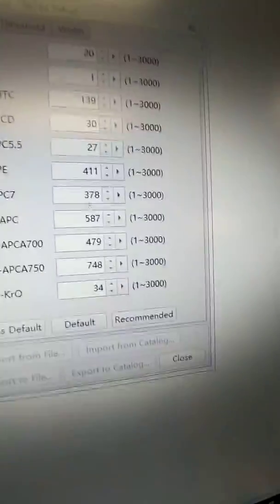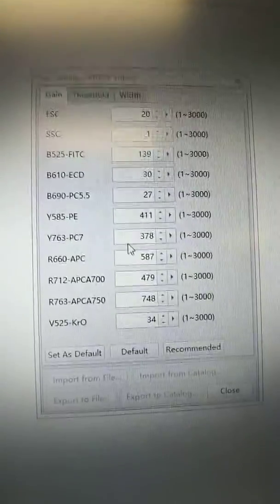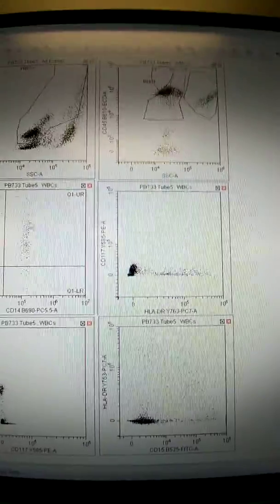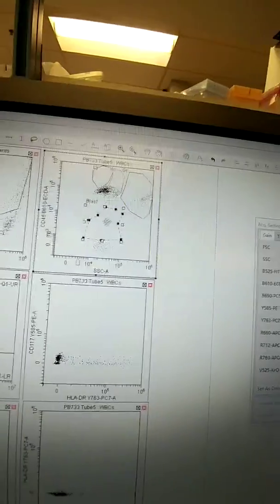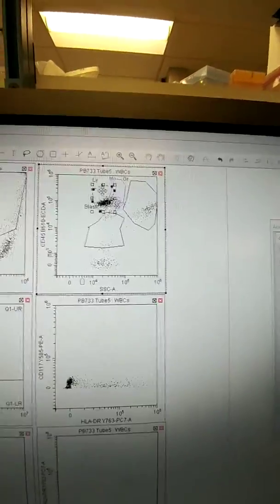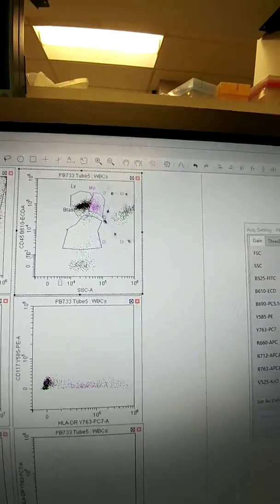Okay, and so over here now you see our PC7 gain has gone from over 1,000 to 378. Quite a difference. Okay, so I'm gonna go ahead, let's hit record. We'll record just a few events of it. We can adjust these. Again, you don't have to now. You can adjust it when you do the formal analysis. And we can hit stop.